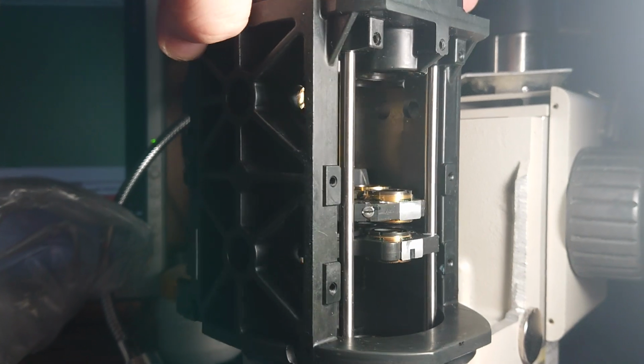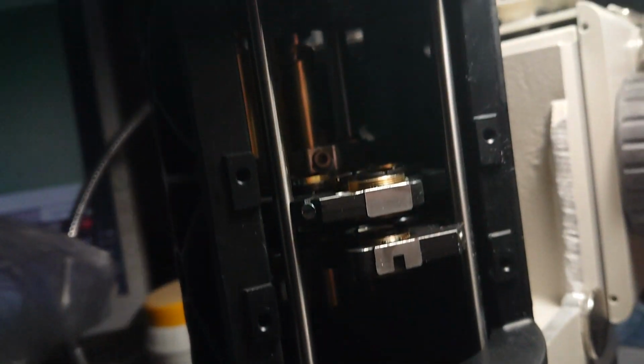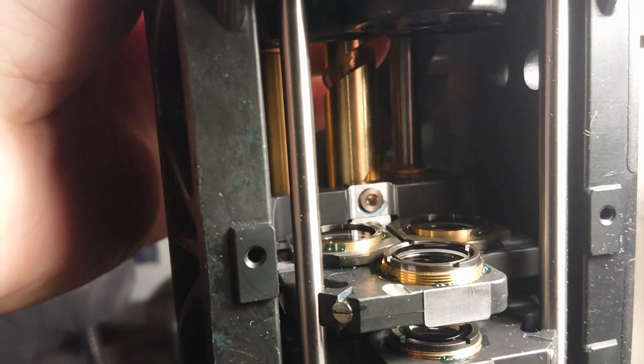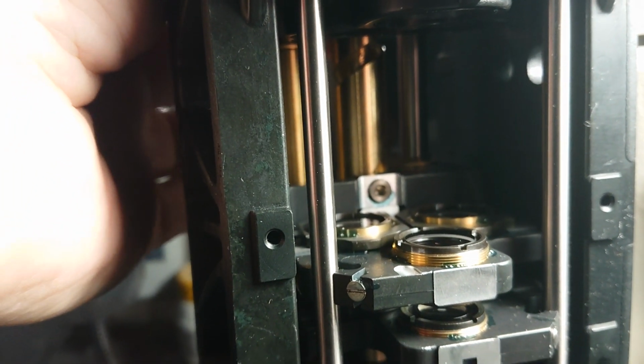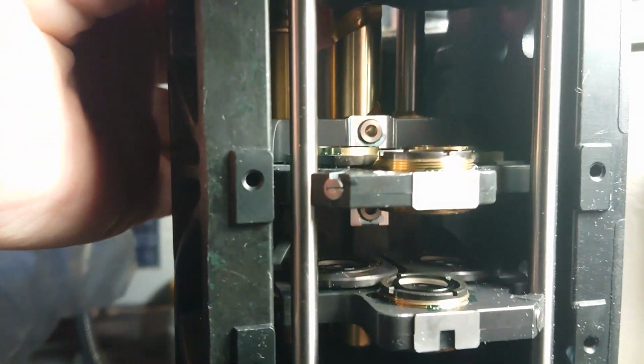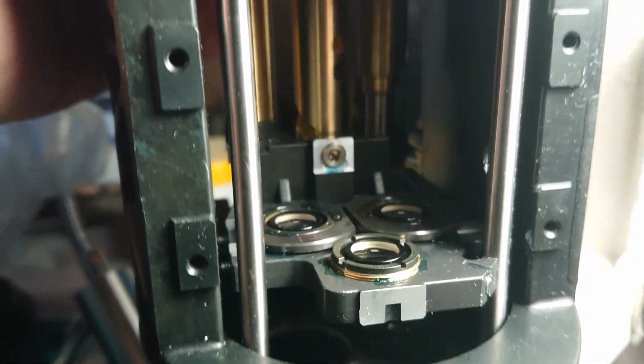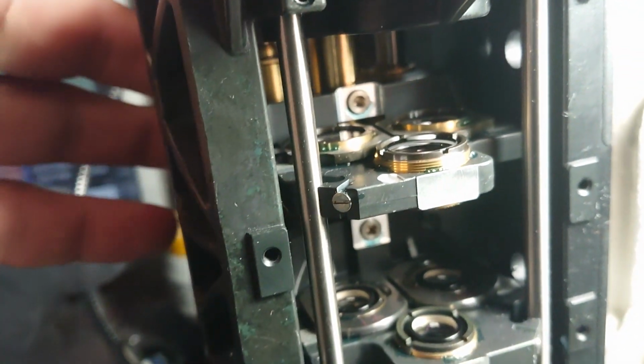You can see so far how it's made. It's made very, very cool here. We see three sets of lenses all over the scope. The first, bottom objectives, after that the second block of three lenses, third and exit one here.